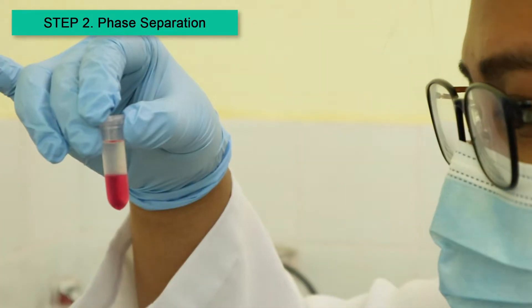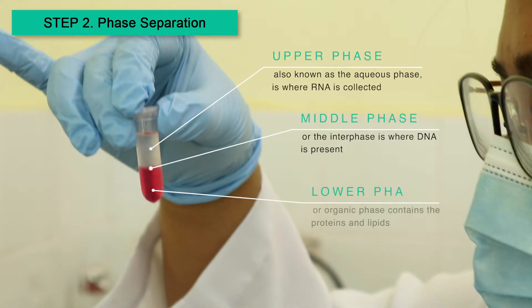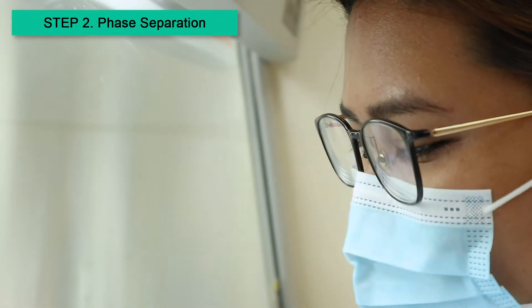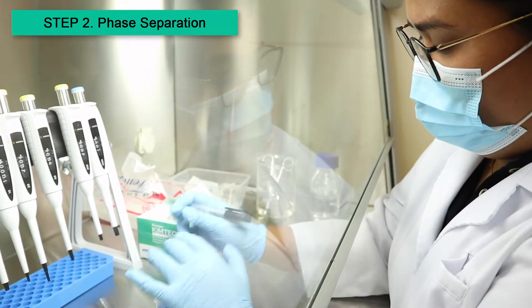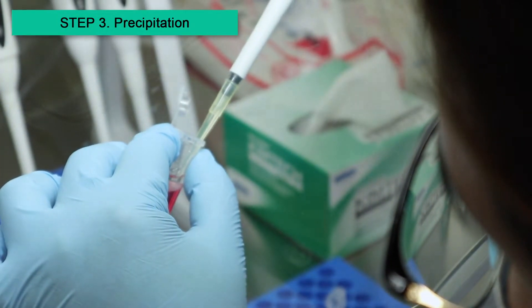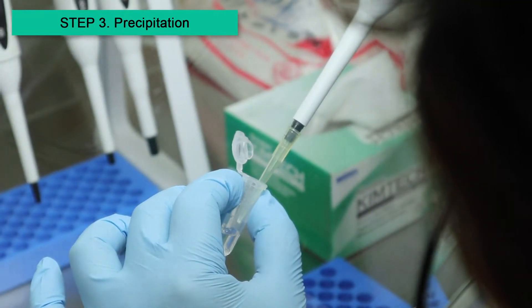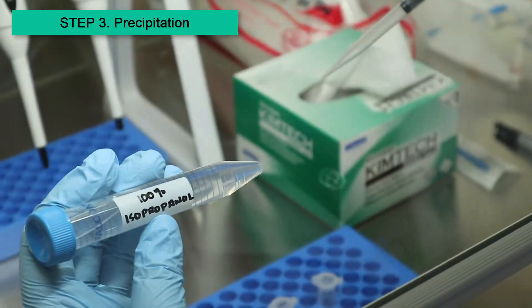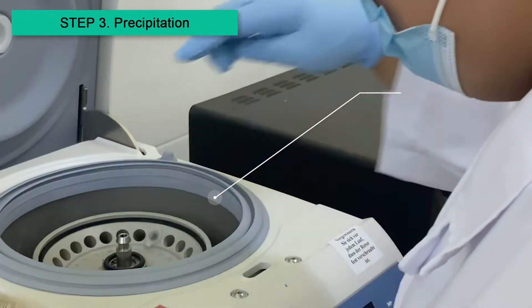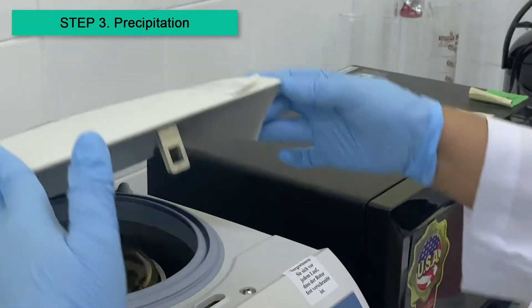After centrifugation, 3 visible layers can be seen. The upper phase containing the RNA is removed and transferred to a new tube. Precipitation is done by adding an equal amount of isopropanol, followed by incubation and centrifugation to concentrate the RNA into a pellet.